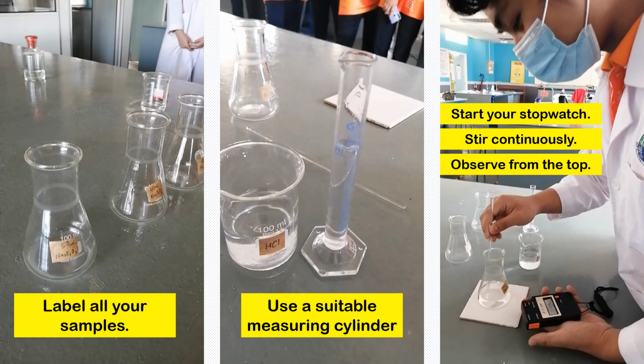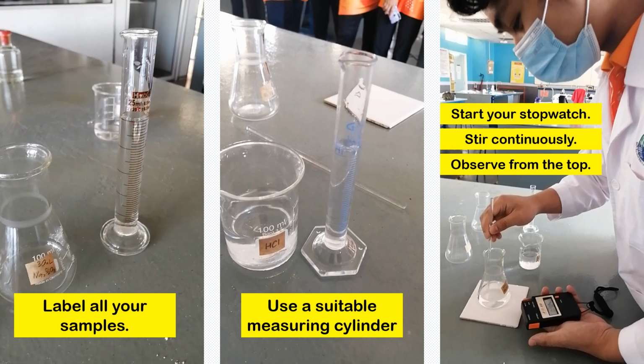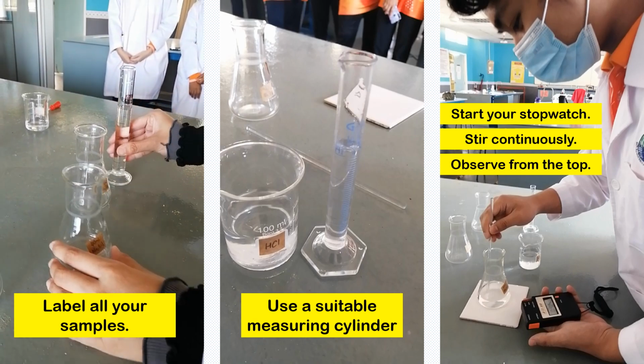Next, prepare the diluted sodium thiosulfate. Again, don't forget to label all your samples.